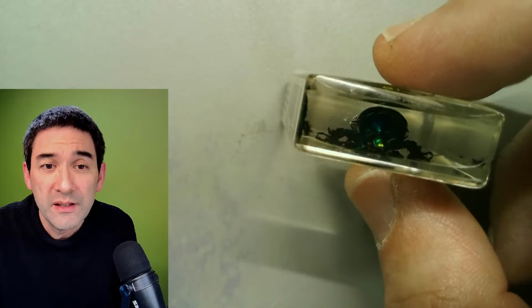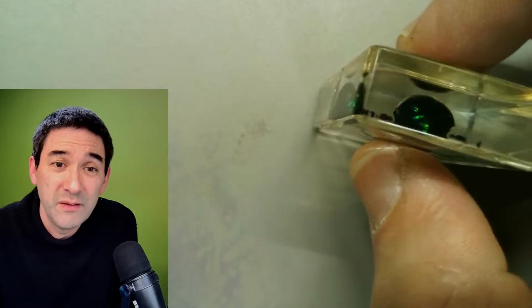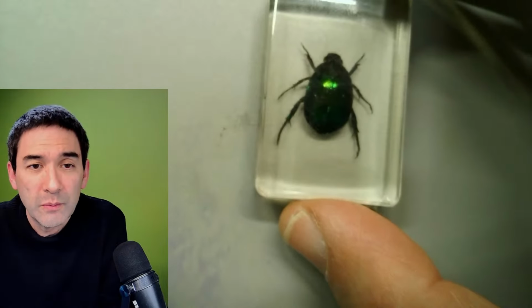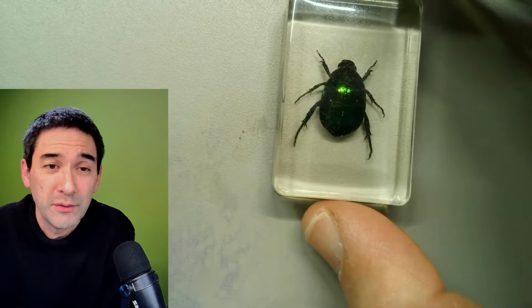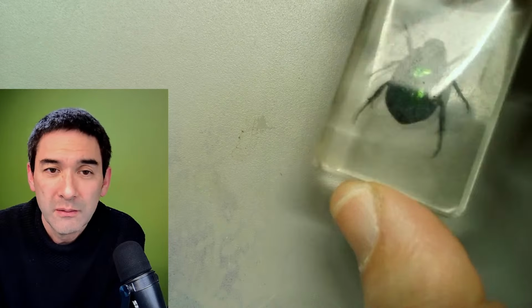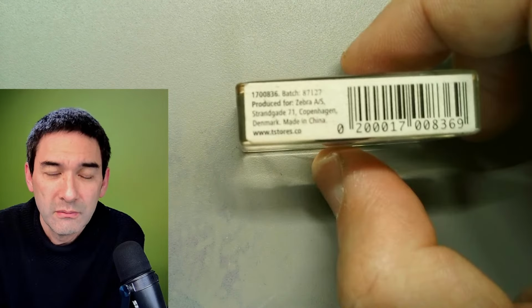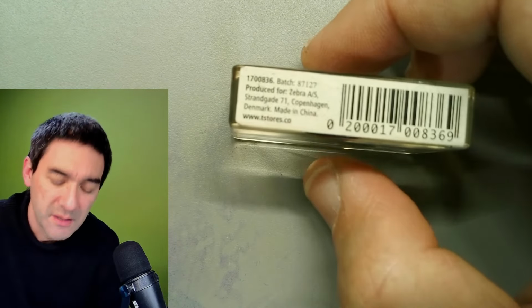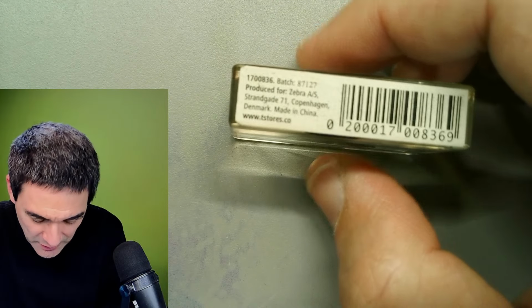You gotta know what it is, at least some kind of scientific name. If you already bother making one of these nice specimens, at least put down the name. But then again, you'd probably have to know what it is, and maybe the people who made those didn't know that. So it's a little bit of a pity.